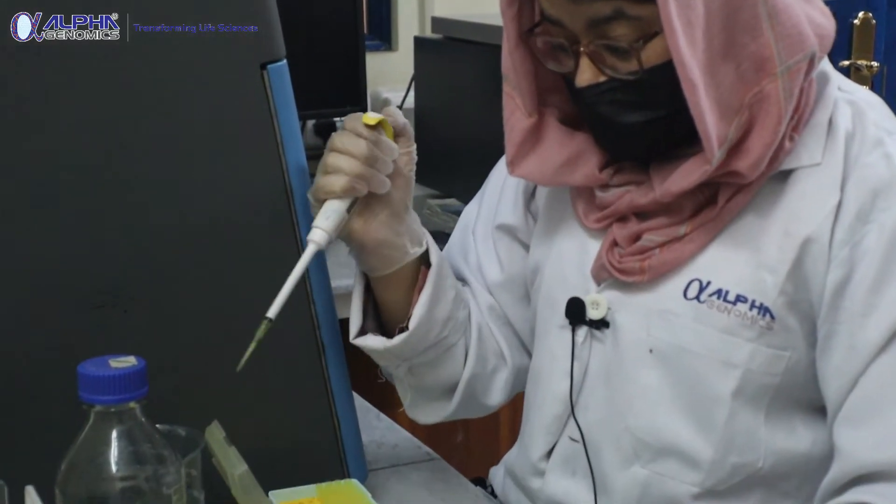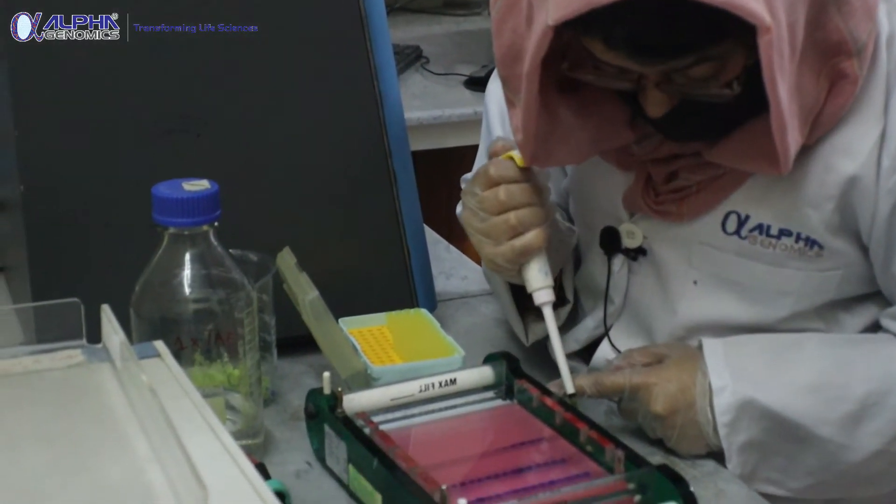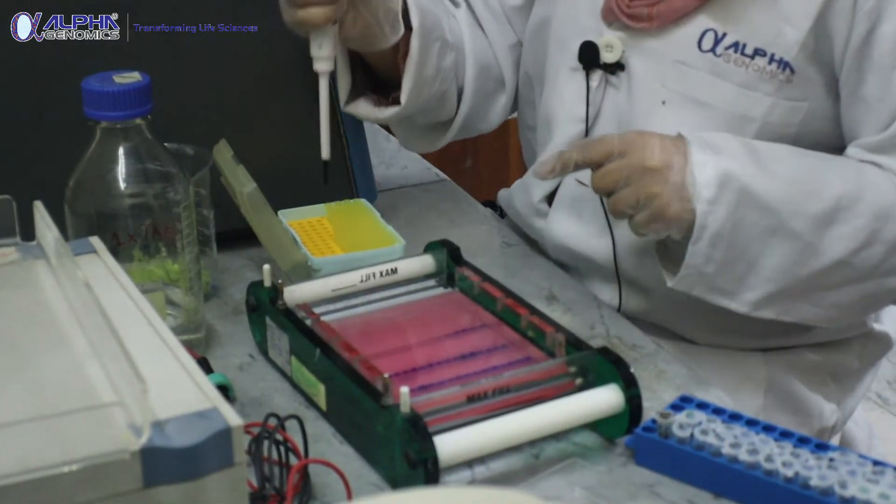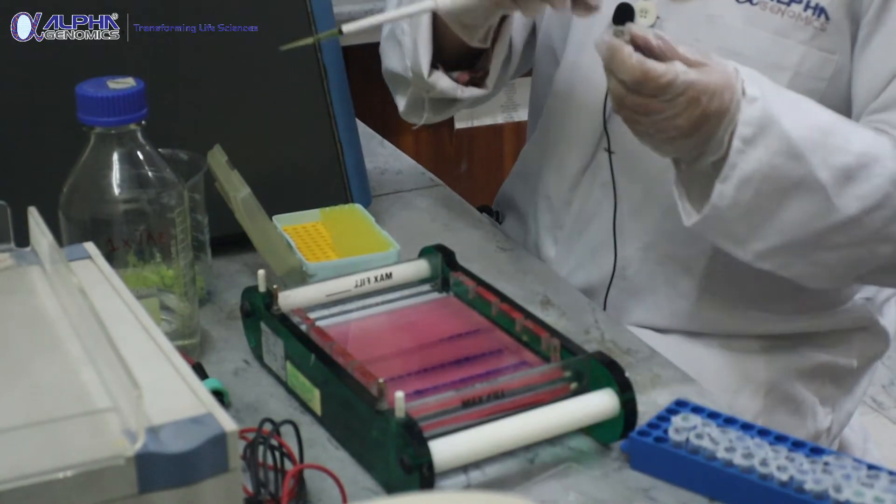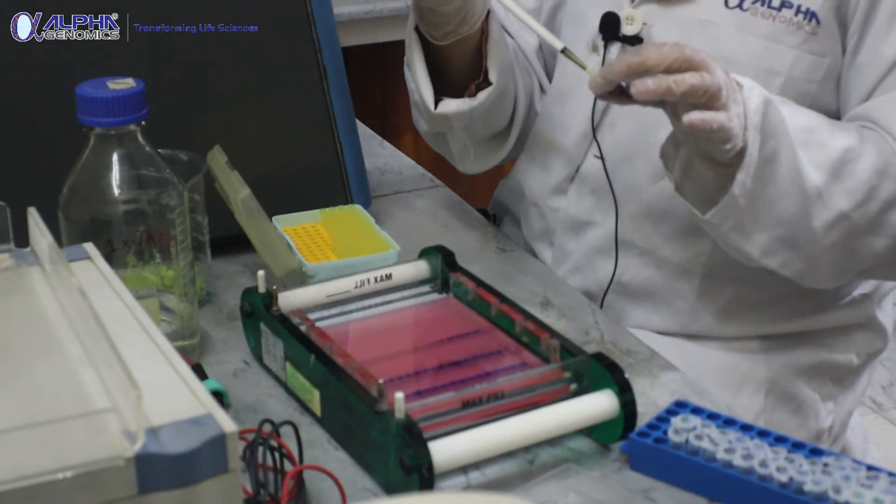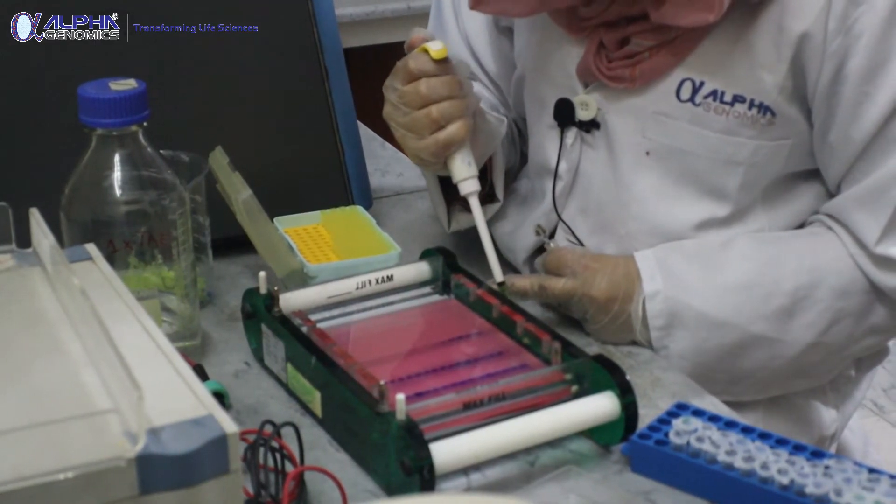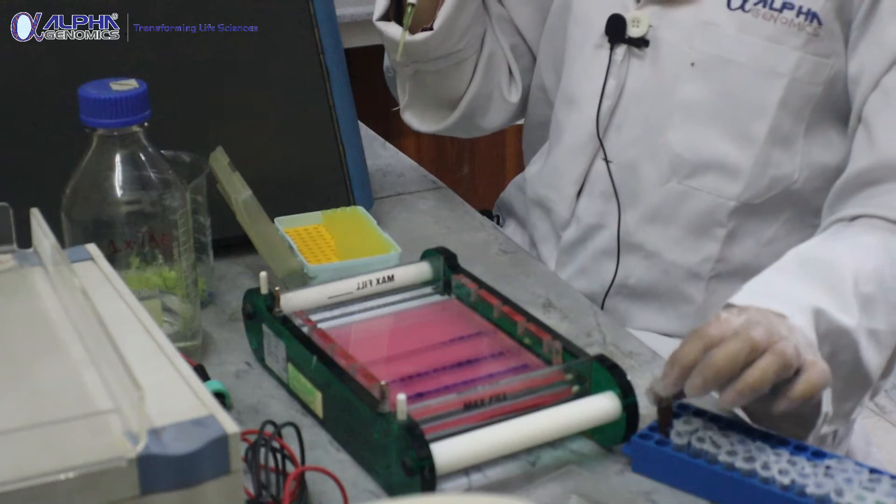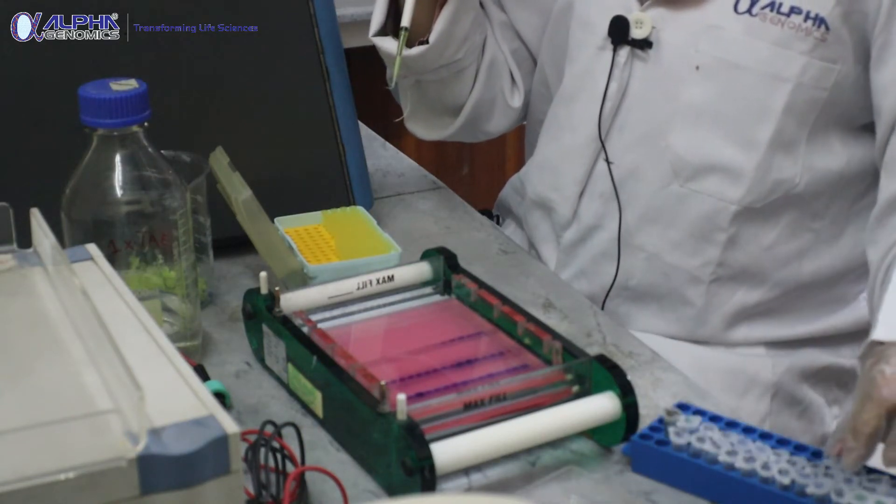Now after this loading I will run the DNA and provide current. It will be connected to this power supply over here. You can see the power supply is present and its purpose is to provide the current.